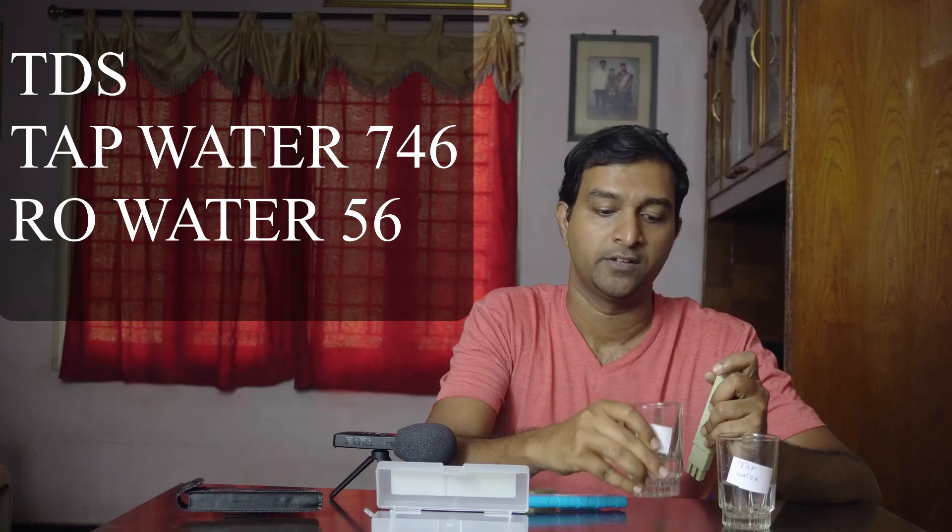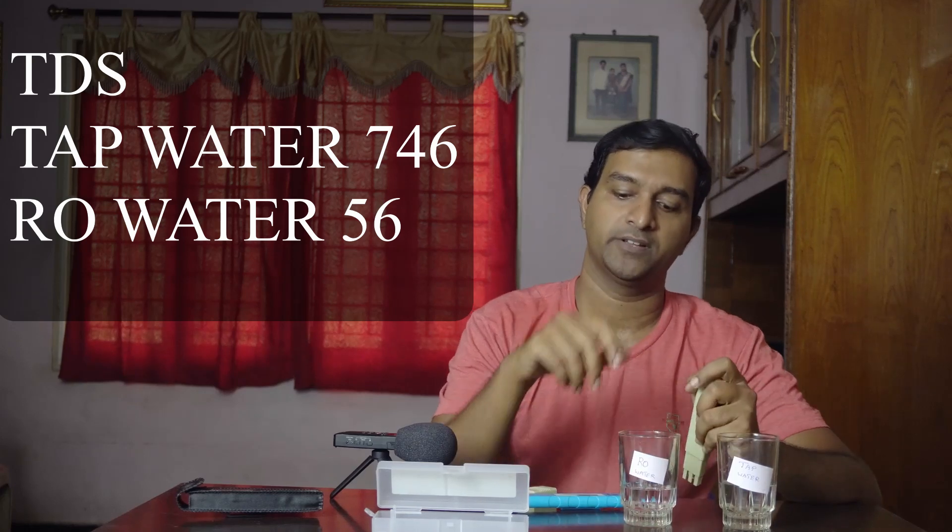You need to check the calibration. We can check the calibration. As you can see, we have an acidic reading. It has a good sensation. That's why pH is very important.